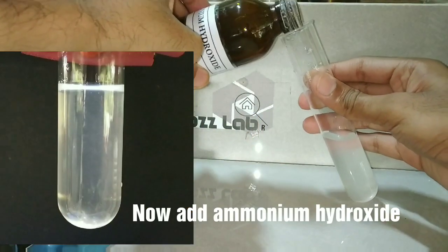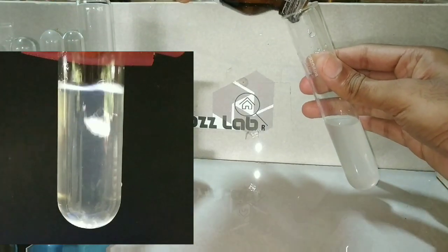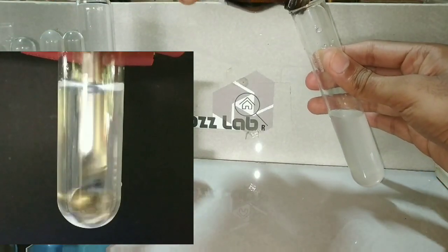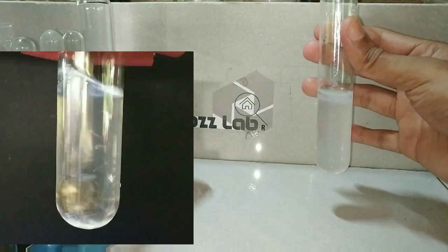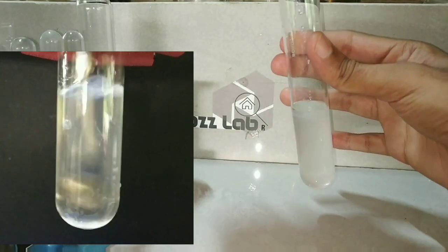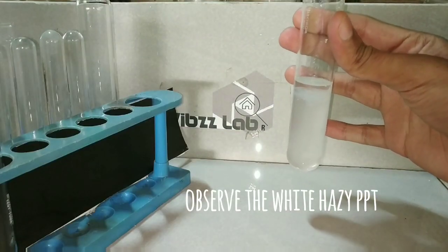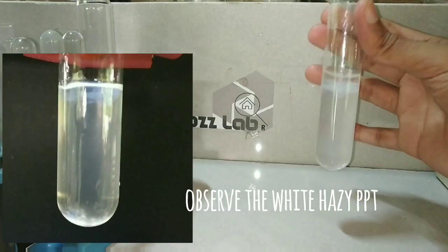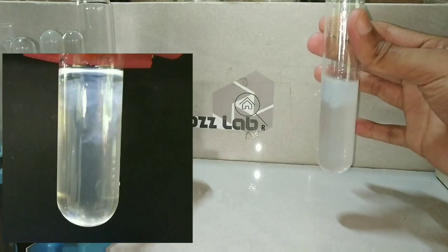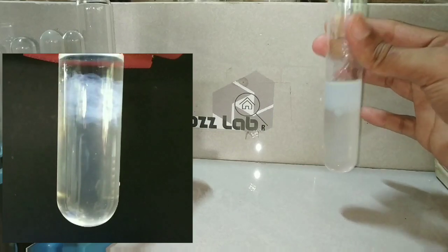Now I am adding Ammonium Hydroxide into it. You can see that on adding Ammonium Hydroxide, there is formation of a white hazy precipitate, or rather a gelatinous precipitate, that is formed.